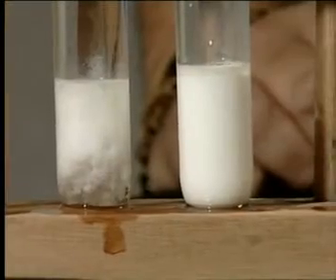Notice that both solutions are identical in appearance. Watch what happens when we add a little barium chloride solution to each of the solutions in the test tubes. What do you see? It's pretty clear to see that a white precipitate forms in both test tubes. This means that both the sulfate and the carbonate anions have reacted with the barium chloride to form barium sulfate and barium carbonate, which are insoluble.